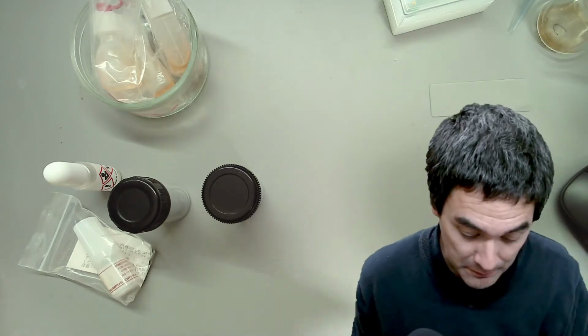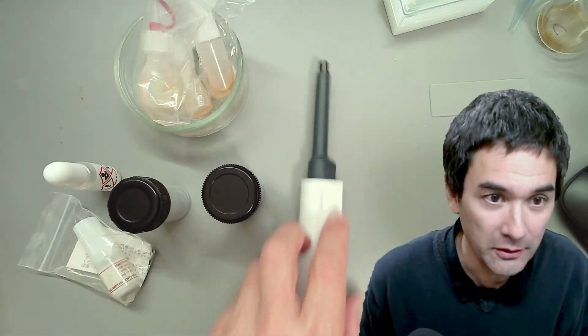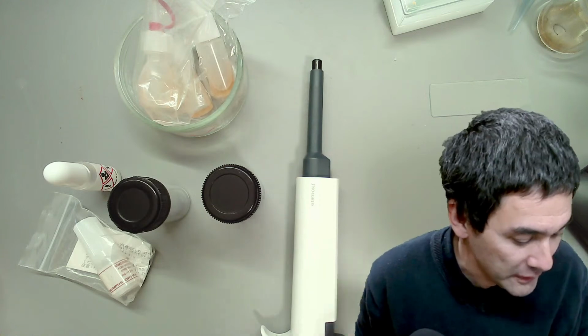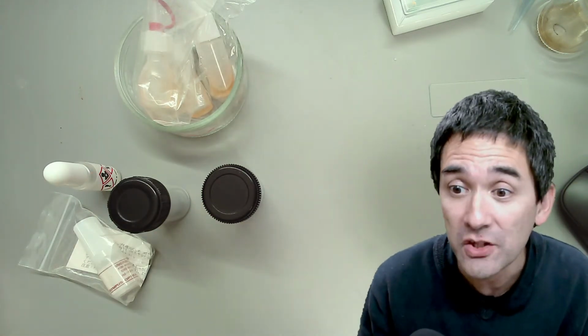Okay, so first of all, you see my desk over here. I have prepared a lot of things already, but I would like to show you first what oil immersion microscopy is and which objectives you need. And of course, if you want to ask any questions, then please post them in the chat.